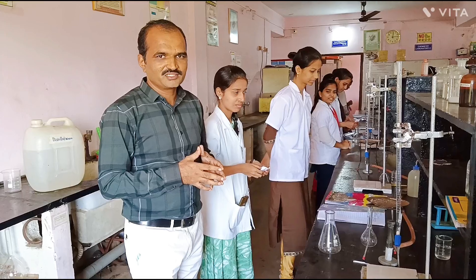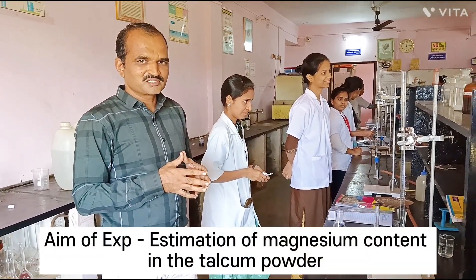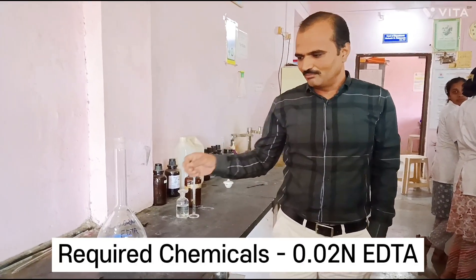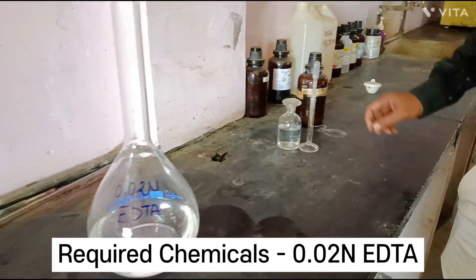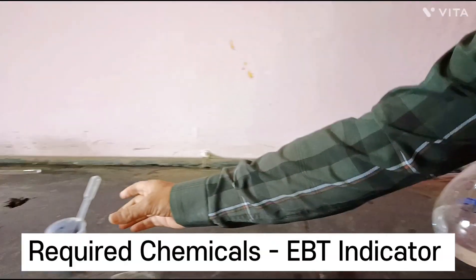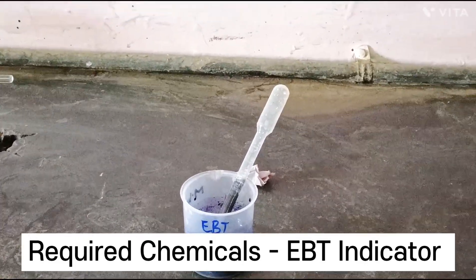Hello students, today we are going to perform an analysis of a commercial sample — the estimation of magnesium from talcum powder. This experiment will require the complexing reagent 0.02 normal EDTA, a buffer solution of pH 10, and EBT indicator for the titration. The type of titration is complexometric titration.